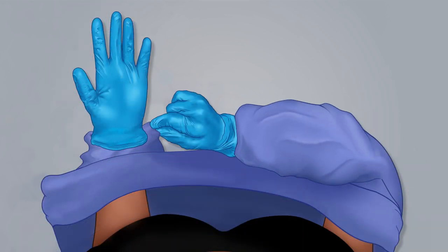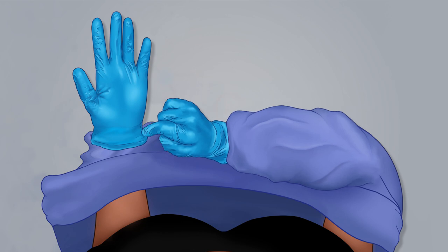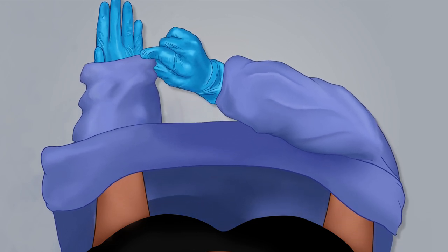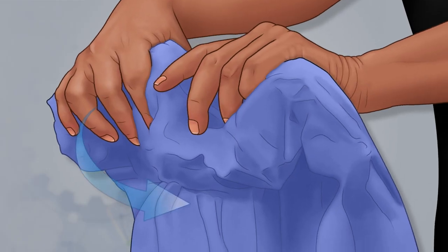Once off your shoulders, remove your arms from the sleeves. Before completely pulling off the gown sleeves, pinch the gloves and sleeve together to help peel off the gloves. Roll the gloves and gown inside out into a bundle.